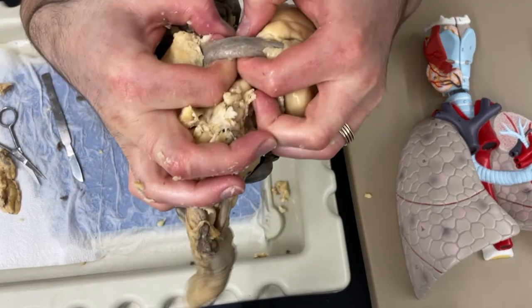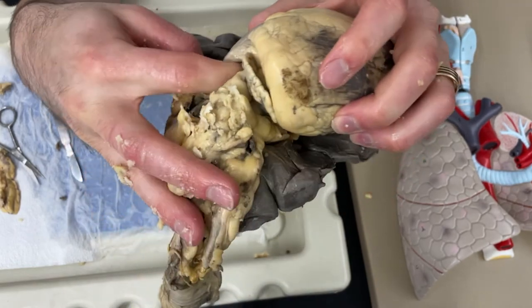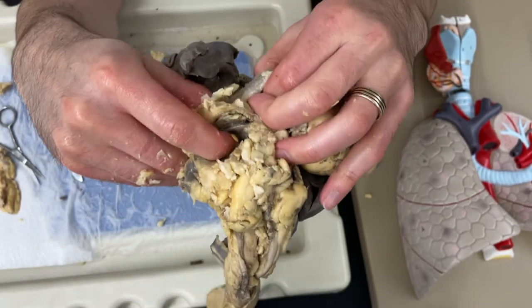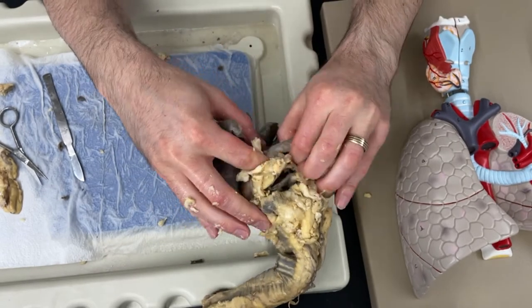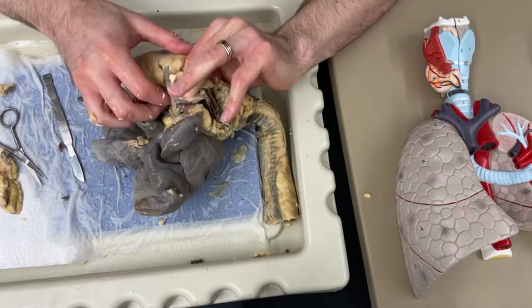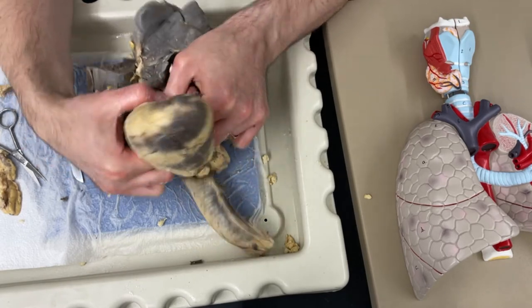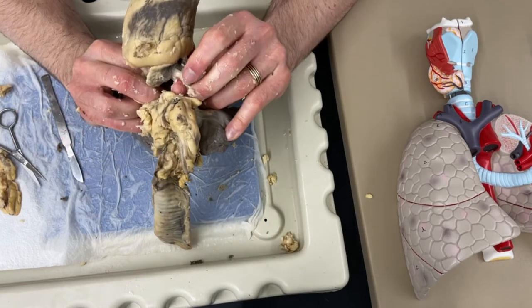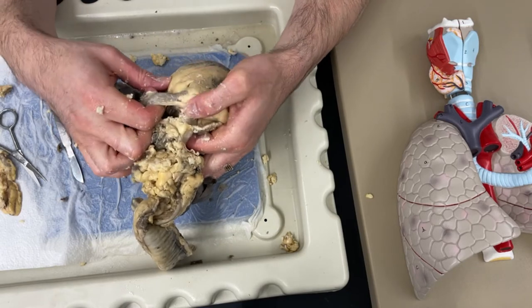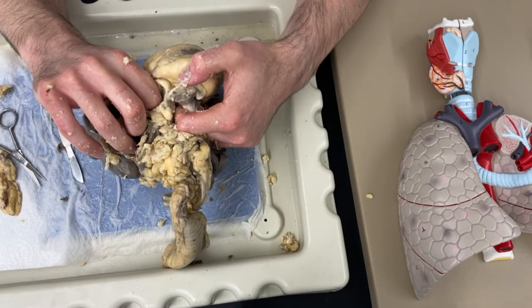For example, I've isolated this blood vessel and I don't know what it is yet, but it's coming from the heart and it's connected somewhere. So I can try to see if it's connected to the lungs - and if it is, that's going to be one of my pulmonary arteries or veins. I think I've found my five vessels: I've got one up here, one down there, one on this side, and then one here and one there. Those five are going to correspond to the pulmonary artery, pulmonary vein, superior and inferior vena cava, and the aorta.